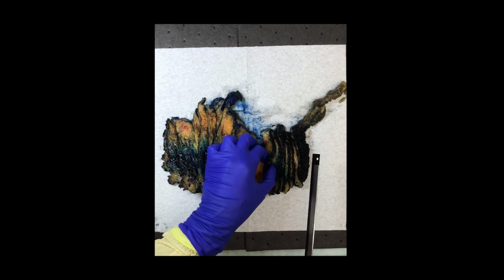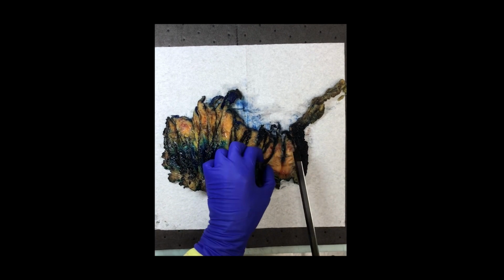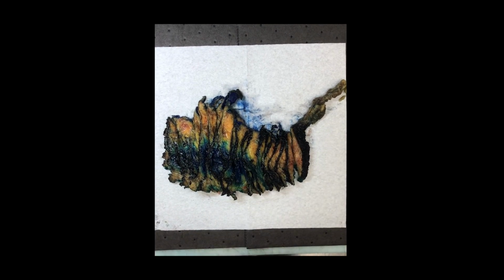The reason it's so important that it's cut all the way to the skin is that if you don't, you end up getting really wedge-shaped pieces of tissue. That can be really difficult when you're trying to gross a specimen because it's so uneven that you'll have a larger anterior margin and then a small little posterior margin.